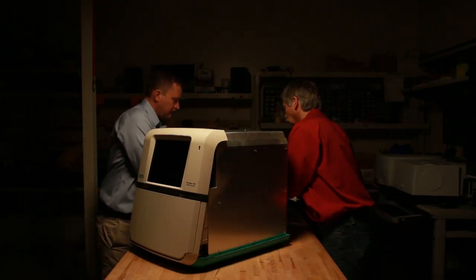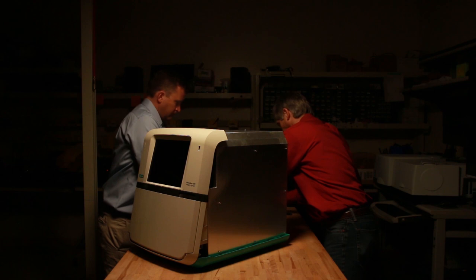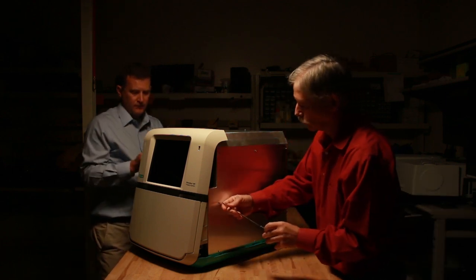you want to make sure that you can get the sensitivity from the longest piece of film and from the shortest. So you want to aim at a better dynamic range, which a single picture will give you. You have more concern for sensitivity on an imaging system when you're looking at Western blots, which are light-starved applications — typically chemiluminescence and far red fluorescence.